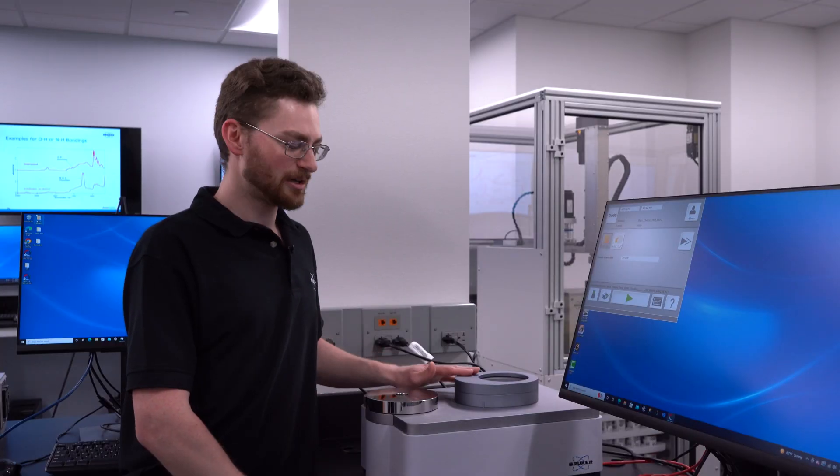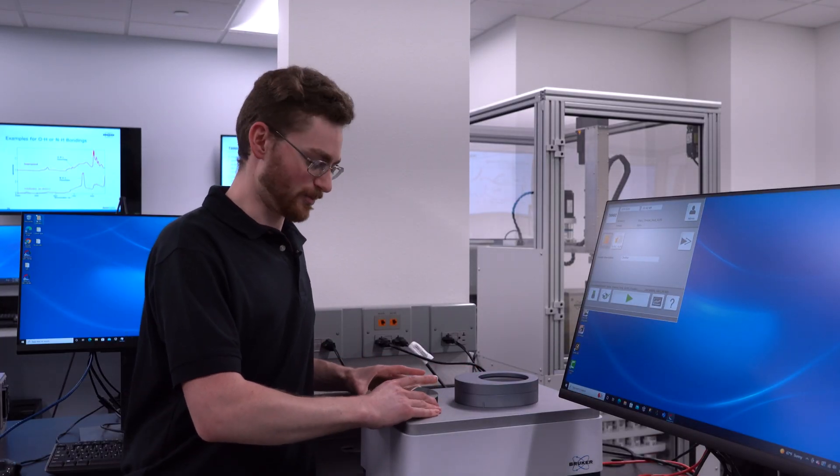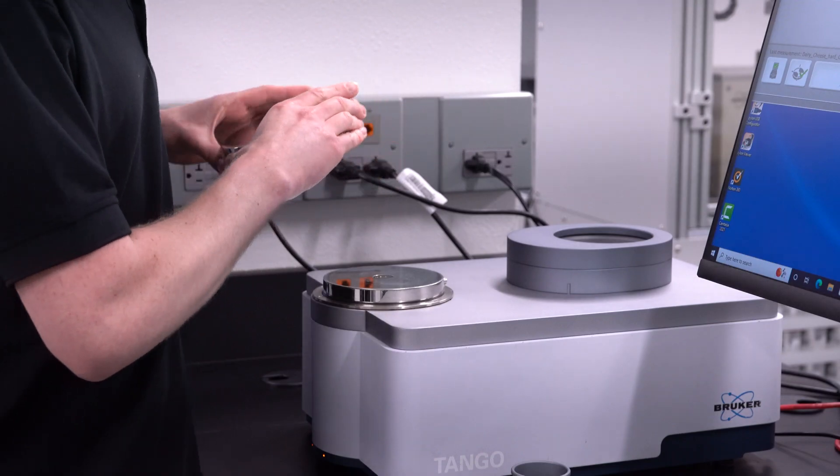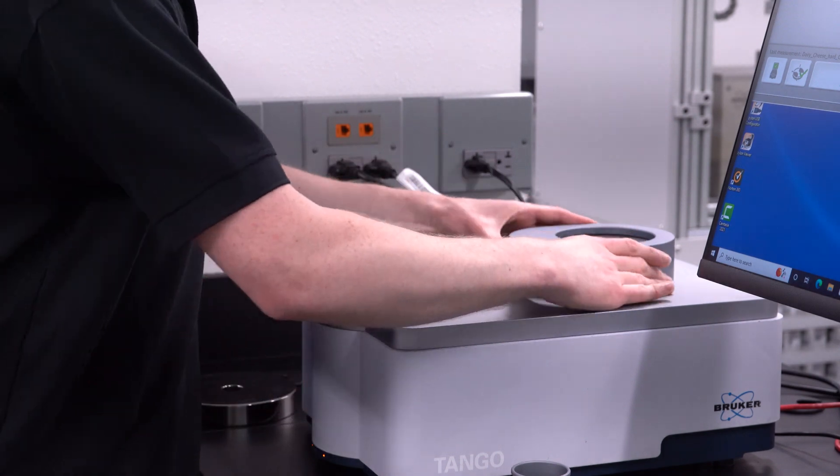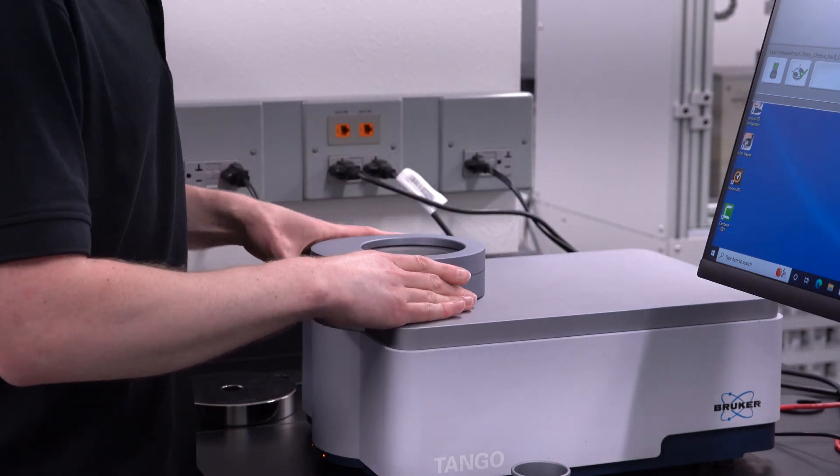The rotator is quick and easy to install. Simply remove the plate and put it into place.